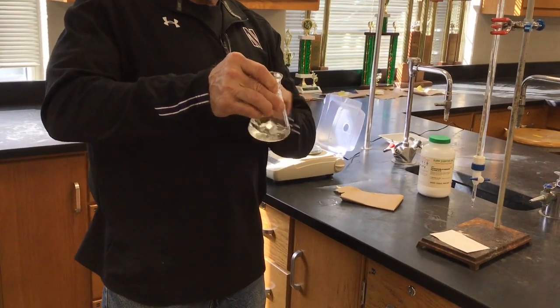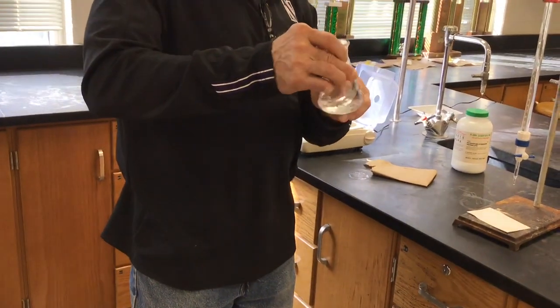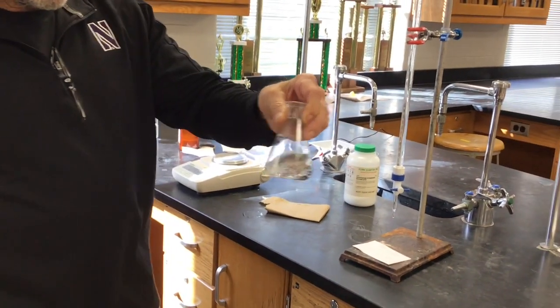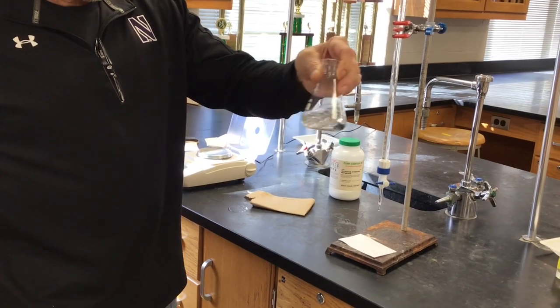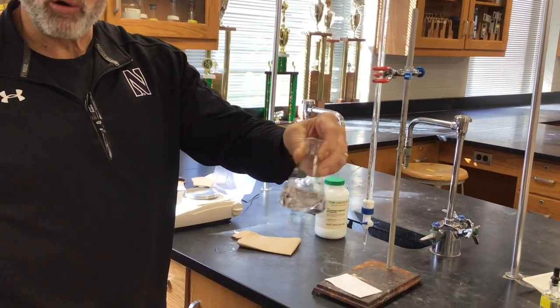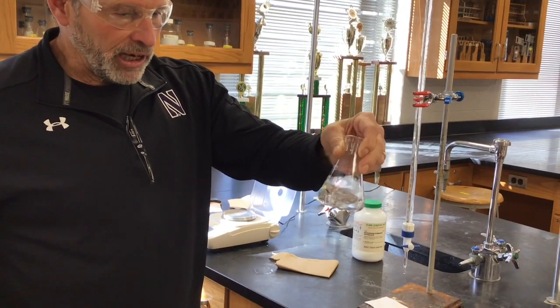The amount of water doesn't matter. We are not looking for a concentration of this acid, so we didn't measure how much water was in there. All we care about is its molar mass. Right. That's why I misspoke. We don't care about its molarity.